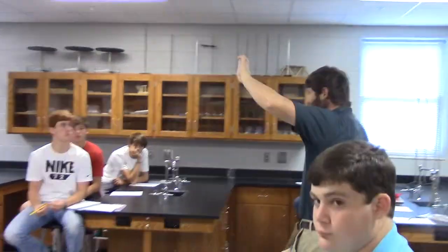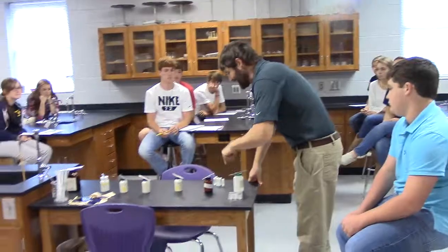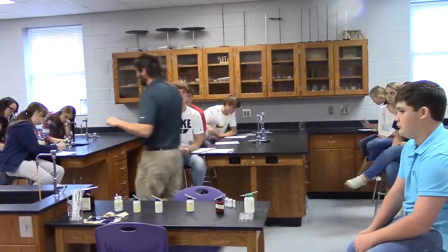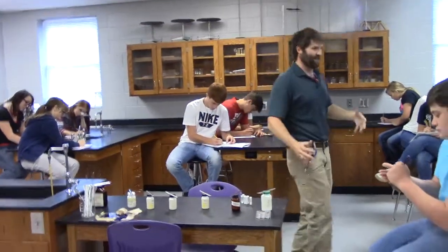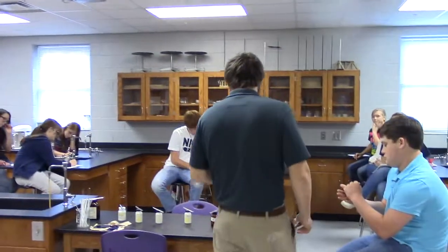So the first thing I need you to do tomorrow, you're going to get one of these 12-well spot plates, and what I'm going to do is come over here. And I guess you could say the first thing I'm going to do is I'm going to get a little bit of all 7 of these. So I'm going to go through and get a little bit of all 7 of these chemicals. You notice how I'm talking slow is to imply that you might write something down at this point. So number 1, get a little bit of each one of these. And by the way, if you want to say salts, that might sound a little sexier and sciencey to say. Obtain one of each sample of salt. Alright, so get one of everything.